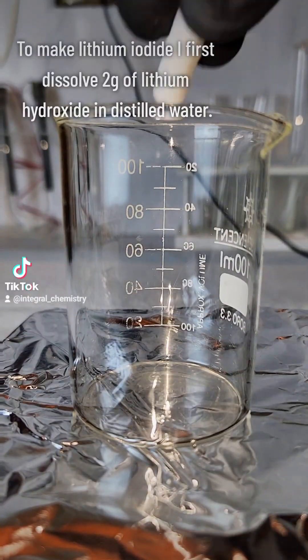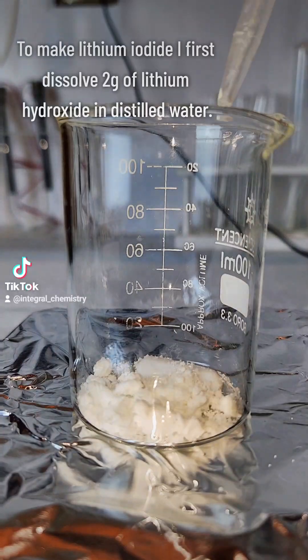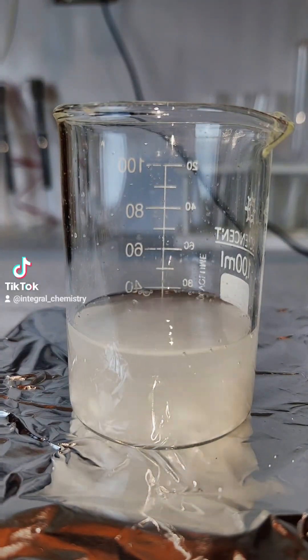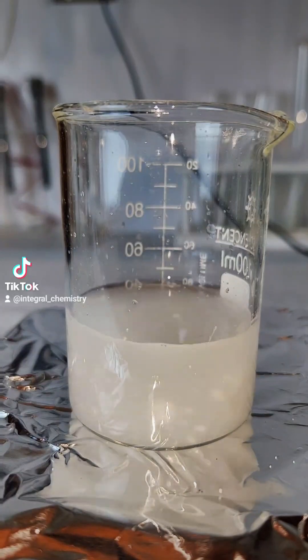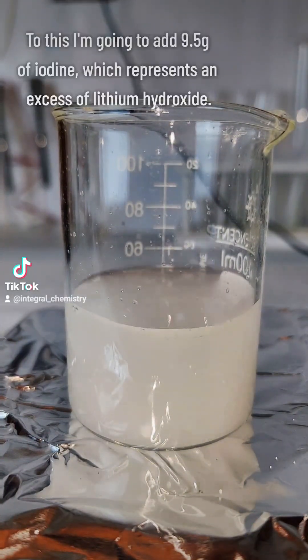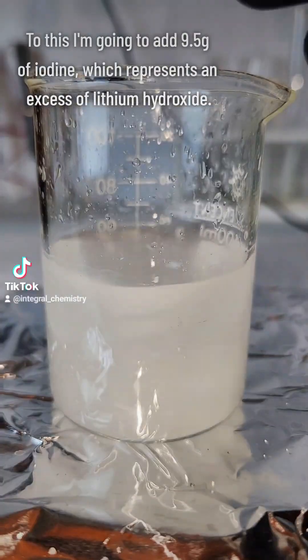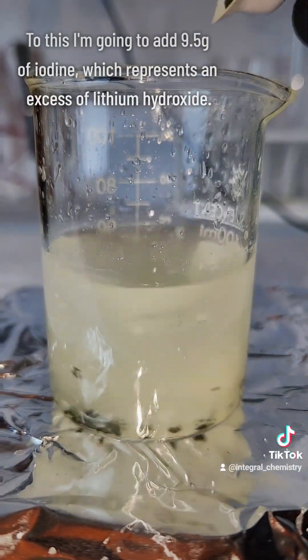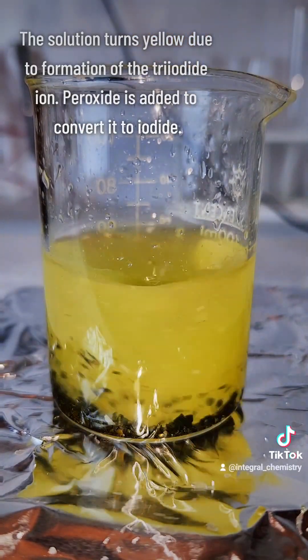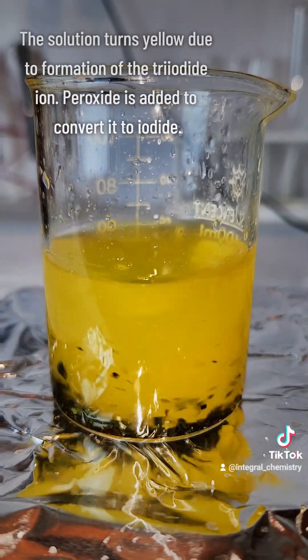Now that I finally have lithium hydroxide, I can make lithium iodide. My first step is to dissolve 2 grams of my lithium hydroxide in distilled water. To this I add 9.5 grams of elemental iodine, which represents an excess of the lithium hydroxide. This is because iodine has an enormous molar mass relative to lithium. The solution turns a bright yellow upon the addition of the iodine due to the formation of the triiodide ion.